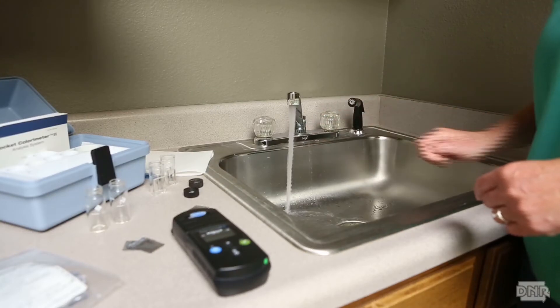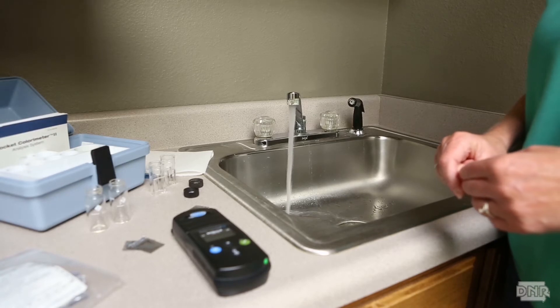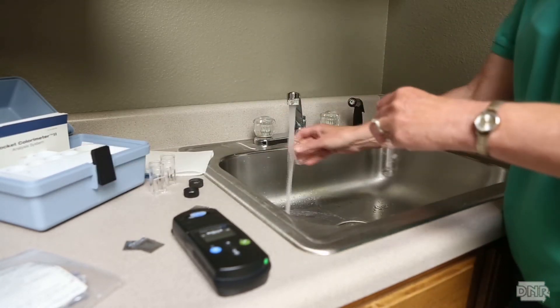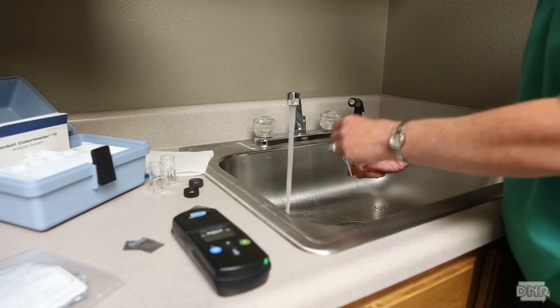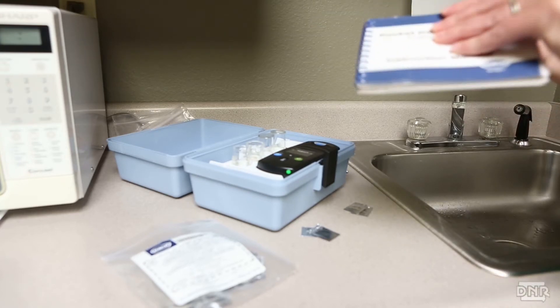To collect a sample, run the water until the temperature is stable and you are sampling the water from the main. Rinse your sample vials three times with the water being sampled. Depending on your instrument, samples of 10 mls or 25 mls are collected. Be sure to read the sample instructions for your specific instrument. It is also very important to be sure your reagents are for the method you are using. Reagents are available for 5, 10, or 25 ml samples.